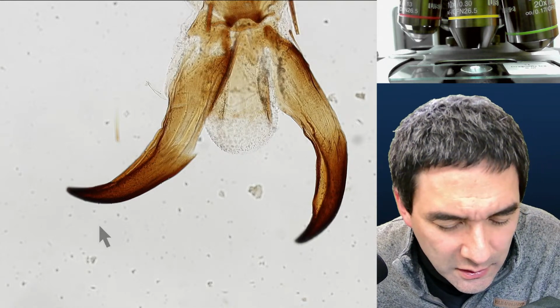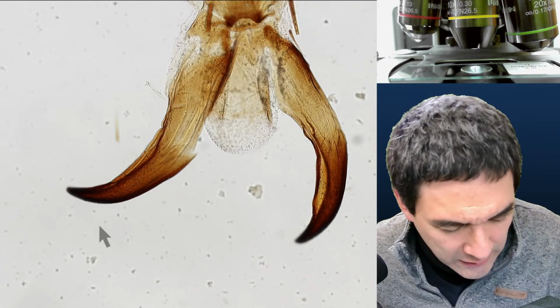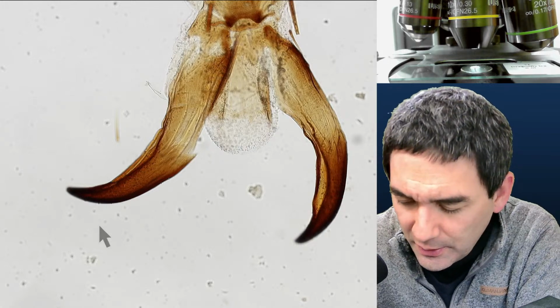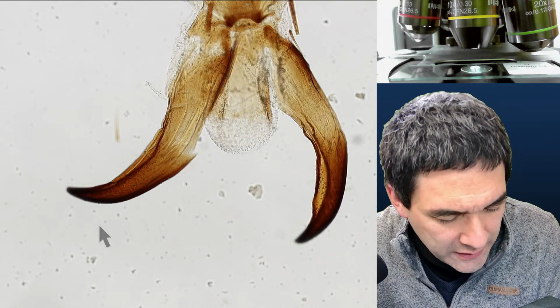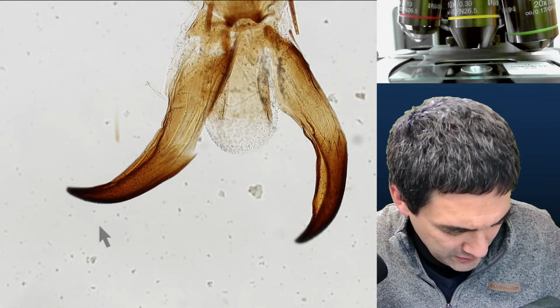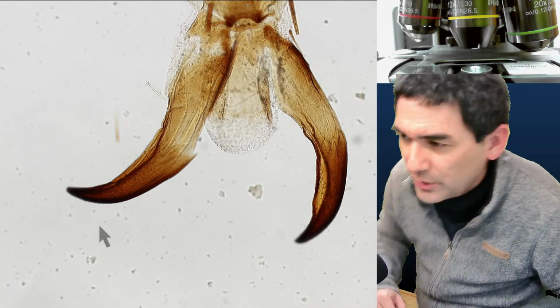Locust. If not, these are the mites here. Mosquito wing, mosquito legs, locust. There was actually somewhere, nope. These are the mite, varroa tick. Okay, mosquito wing, mosquito leg. No. You know what I'm going to show you as a last sample? Just a second, I need to get it.